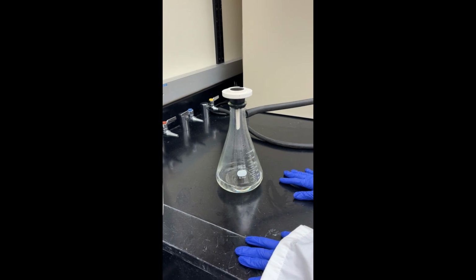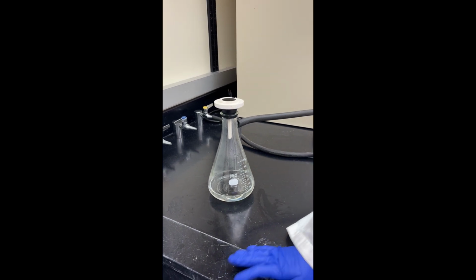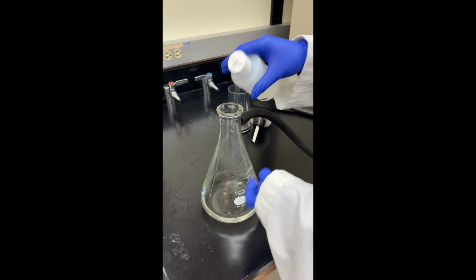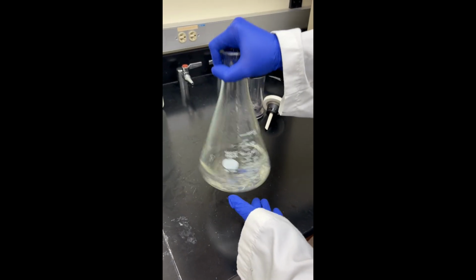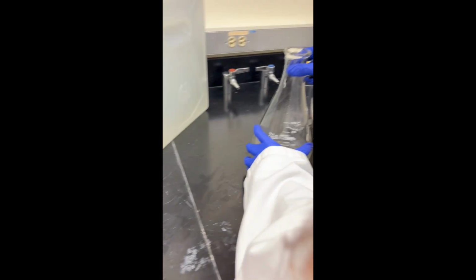Now to clean this out, this is pond water that's nasty and disgusting. Even though I have all the microplastics out, I still have to neutralize the water just so all that nasty stuff doesn't go down the FIU plumbing system. All right, so to neutralize it, I'm going to take some bleach. I'm going to do like 3 drops, or a little bit more. Then I'm going to swirl this around to make sure all of the liquid in there gets neutralized, and then dump it down the sink. Okay.